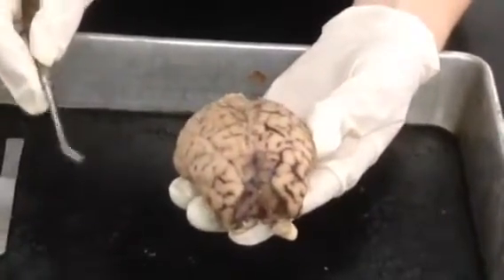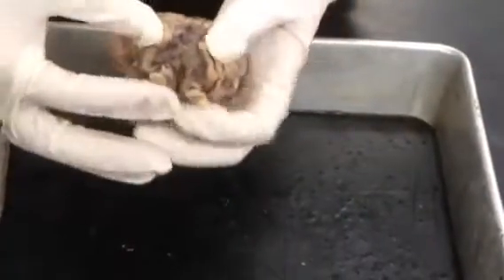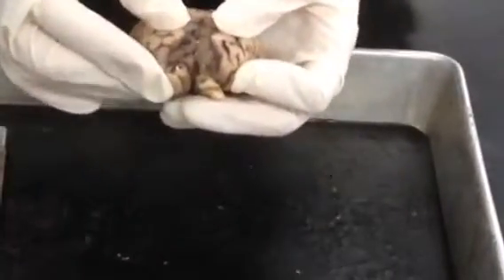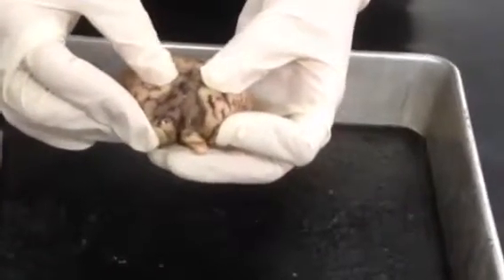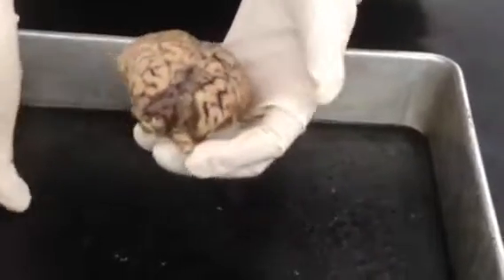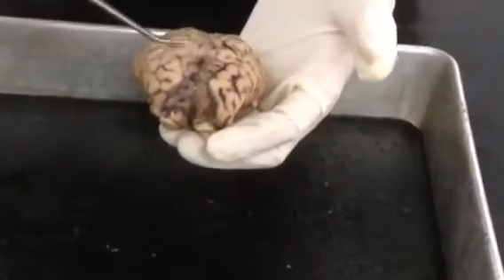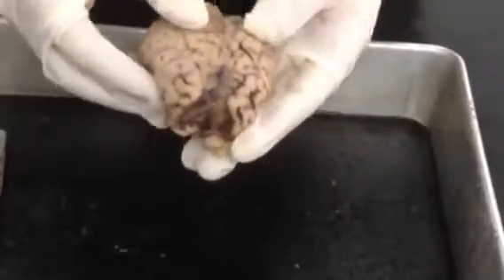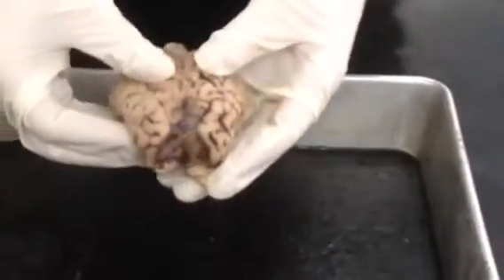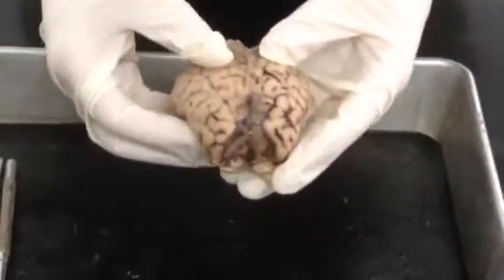Now I will point out the different lobes of the brain. Here we have the right and left frontal lobes. The frontal lobes help to control skeletal muscles and help the formation of words. They are responsible for personality. If you look to see where the gyri change direction, that shows where the frontal lobes end and the parietal lobes begin. Here we have the left and right parietal lobes. This is the area for estimation of distances, sizes, and shapes. It is also the sensory association area.